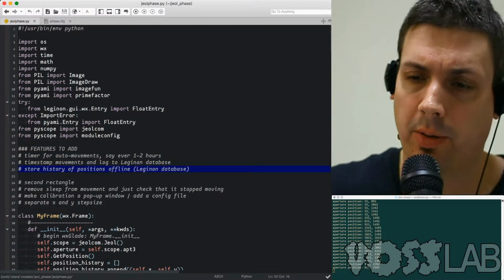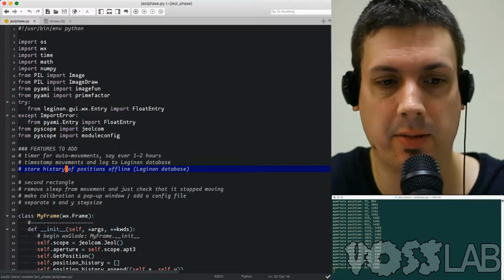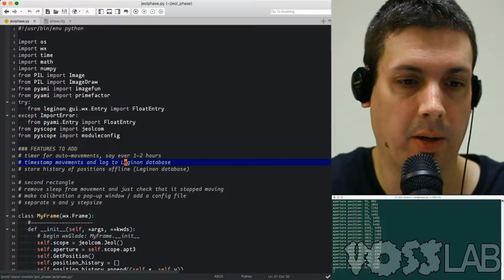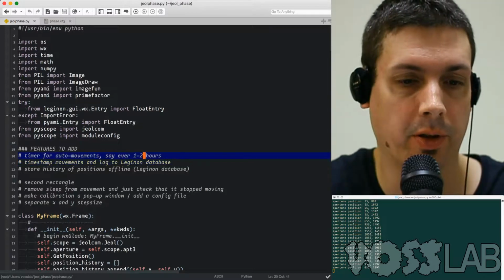I'm going to have to look up the code because I'm pretty sure we're logging the movements on the FEI scope, so we need to do the same thing on the JEOL scopes, or at least maybe store the position offline, maybe in a text file, so people can look it up for the short term. Because connecting to the Leginon database is going to be a little bit more work. Make sure I get it in the right location and it's easily accessible for users on the website as well.